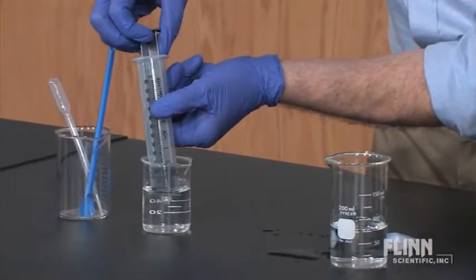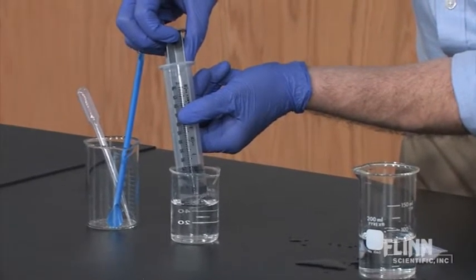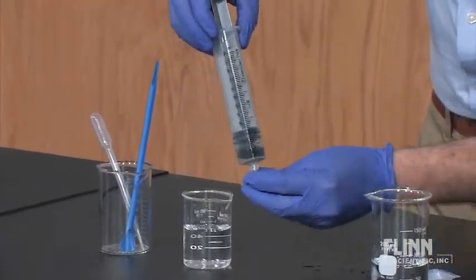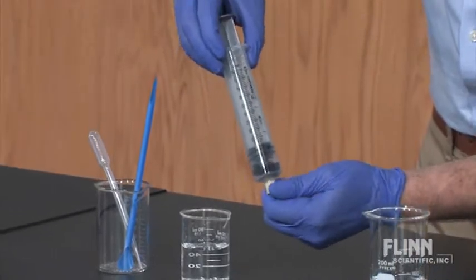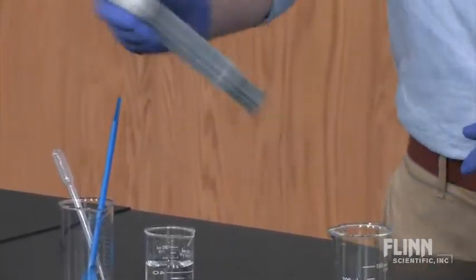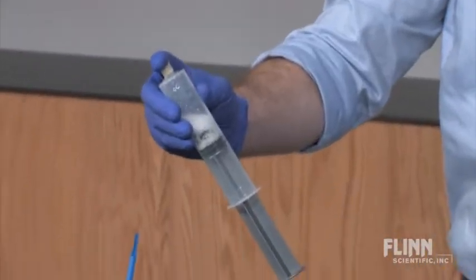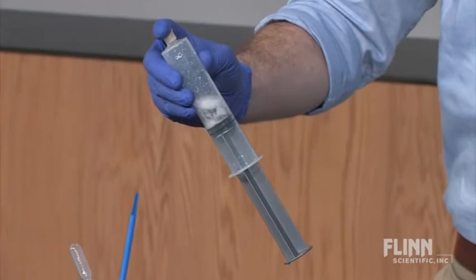Draw in vinegar, cap the syringe, invert, and shake. As the liquid splashes into the vial cap, the reaction will begin and the plunger will move outward as carbon dioxide is formed right before your eyes.